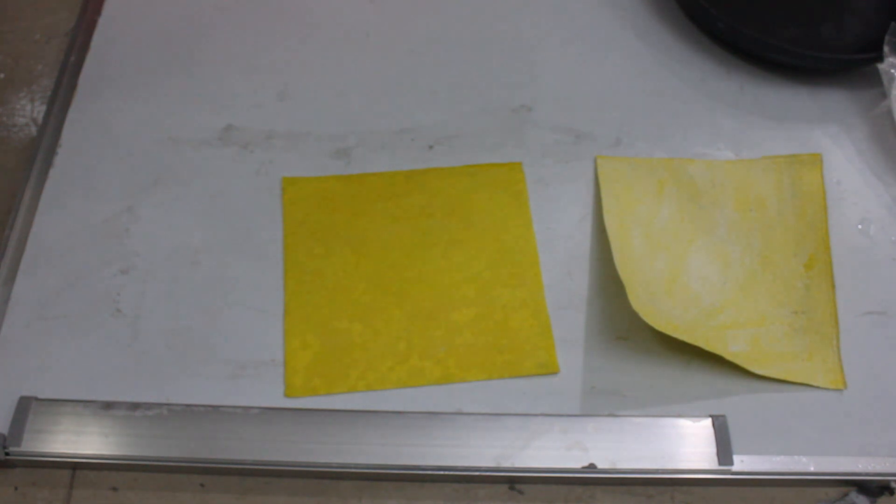Of course I suggest that when you're drying it out, that's when you put it in the frame. Otherwise you're gonna have to rehydrate it and dry it again till it's just the right time to put it in the frame and not too long that it ends up becoming curved. And if you want to speed up the drying, you can always put paper towels and all of that. Remember to wash off the citric acid before drying because such stuff is pretty hygroscopic.